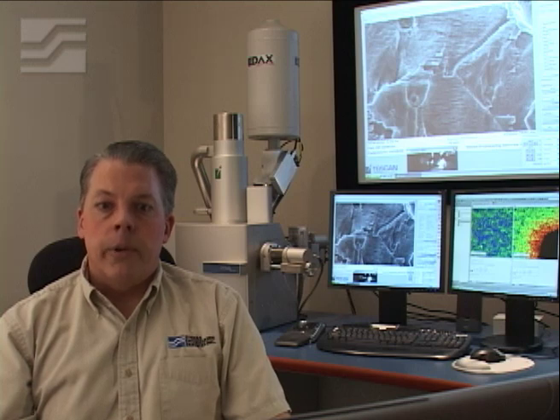We frequently use the SEM to look at broken parts, like medical implants, turbine blades, fasteners, aerospace components, consumer products, and a wide variety of industrial components. The SEM is an invaluable tool for helping us determine why components fail to perform as they should.